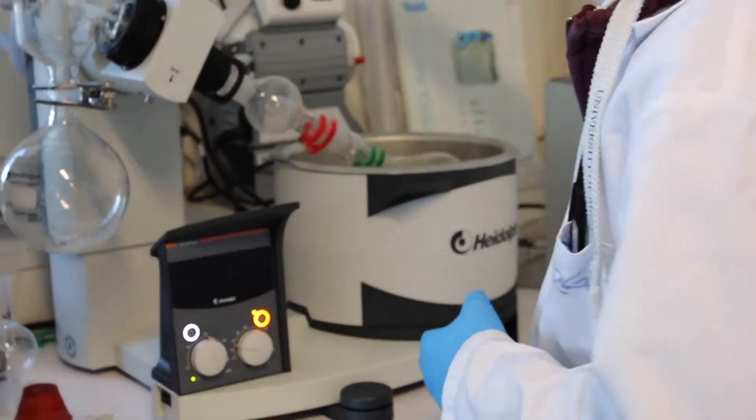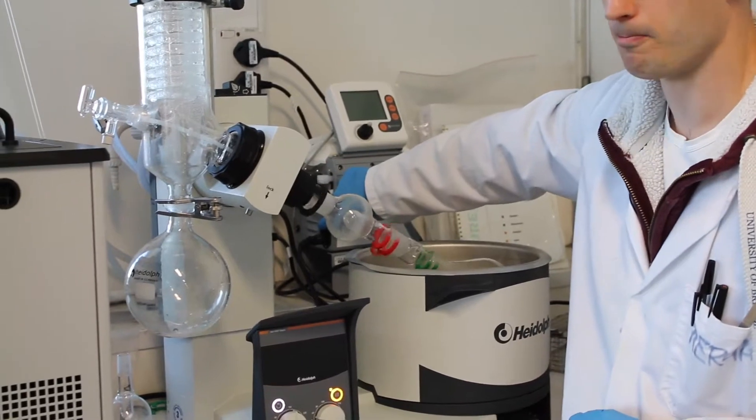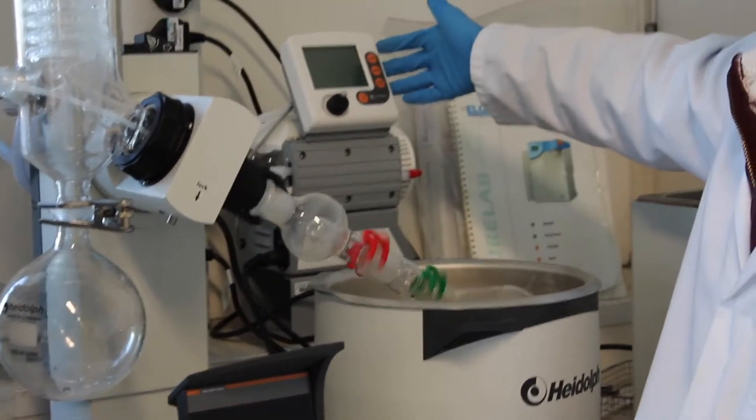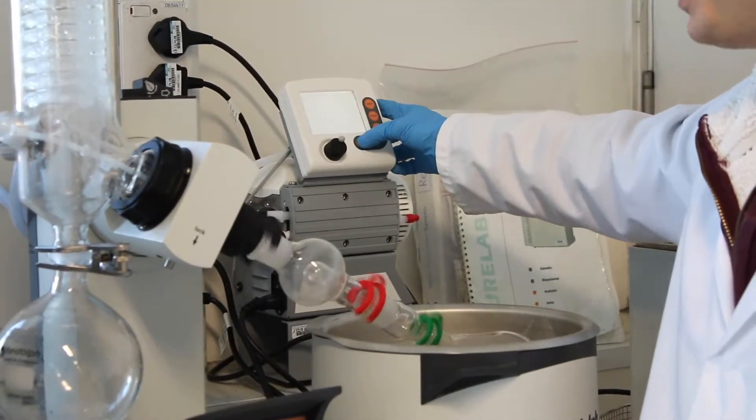Last thing you need to do is to turn on the membrane pump. The main switch is down here. The pump turns on by pressing this button here.